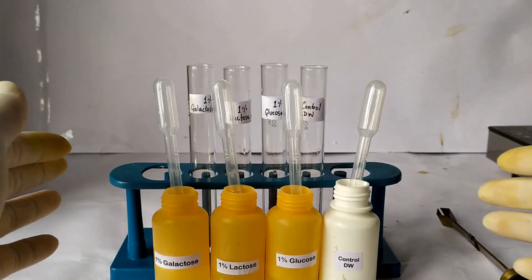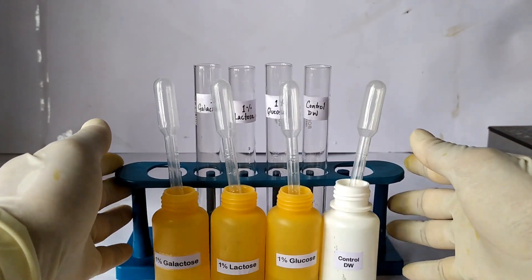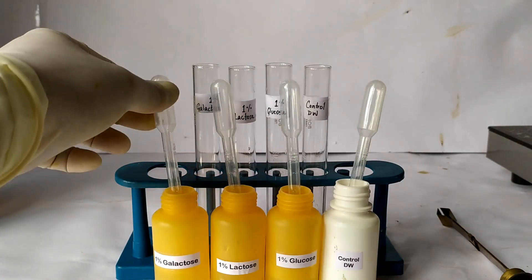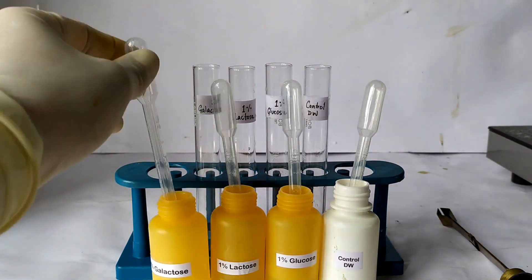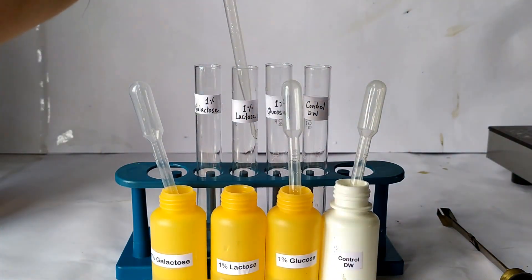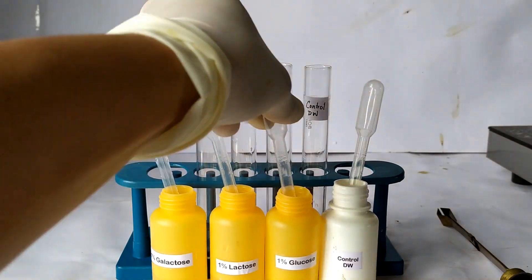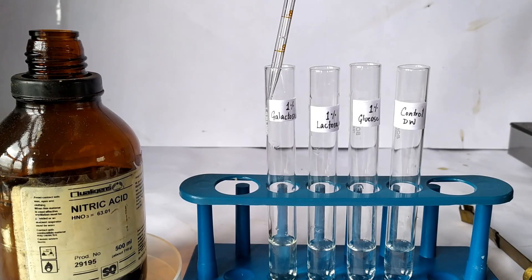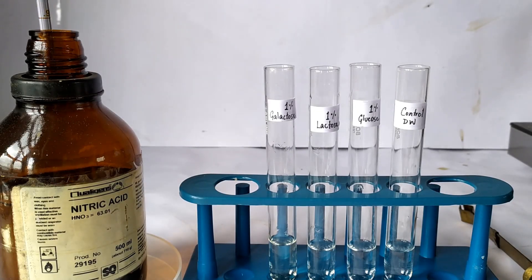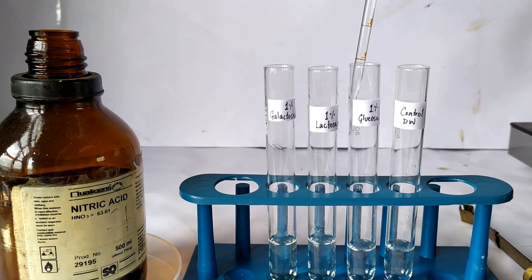Take 4 clean, dry, and appropriately labeled test tubes and place them in the test tube stand. Using 4 different droppers or pipettes, add 5 ml each of galactose, lactose, glucose, and distilled water to the test tubes. Now add 1 ml each of concentrated nitric acid to the 4 test tubes and mix them well by gently swirling the tubes for a few seconds each.